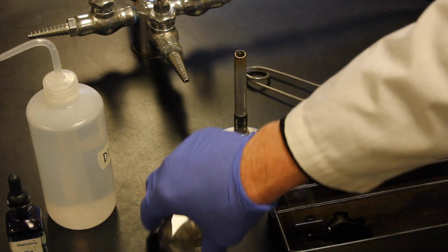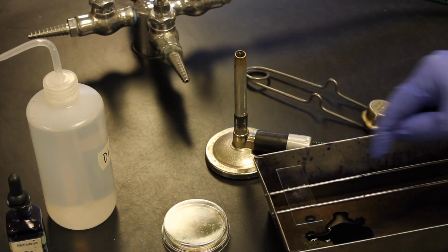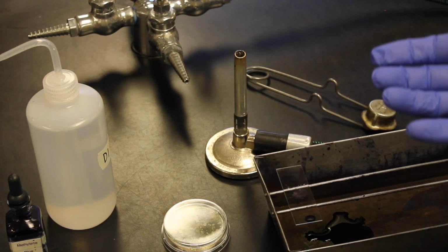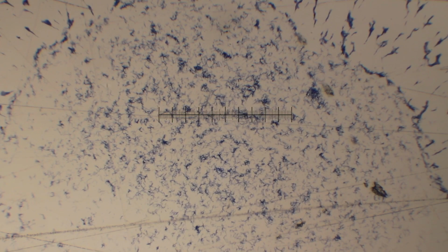I'm going to repeat that process on the contact plate 2 more times, making a total of 3 slides, and we'll view all 3 of these slides underneath the microscope. Alright, so here we have our smear preparation of bacteria taken from a colony that was pressed against a keyboard on a contact plate. The smear preparation was then stained with methylene blue, and these are the results.